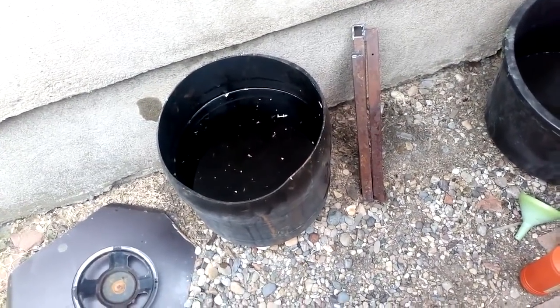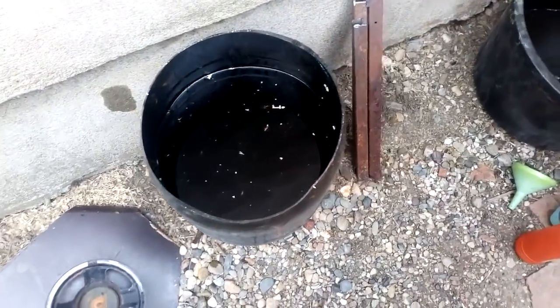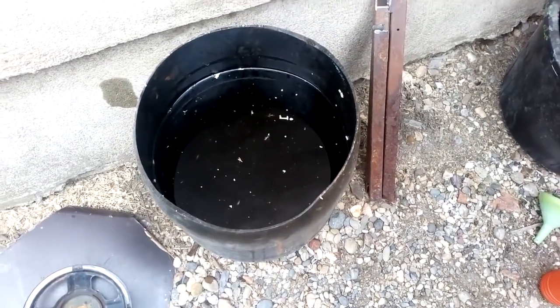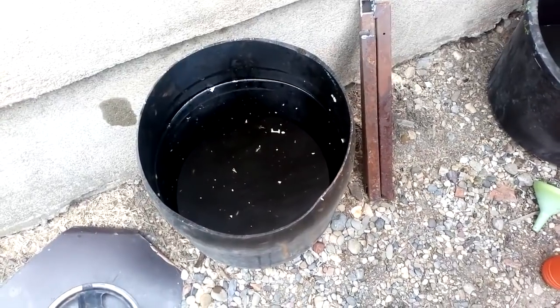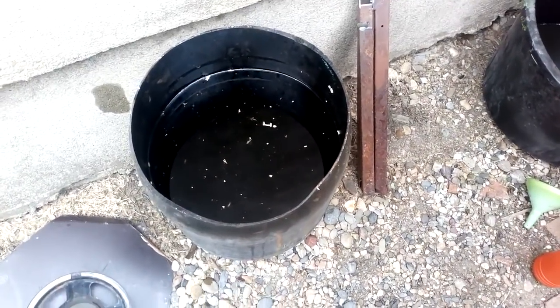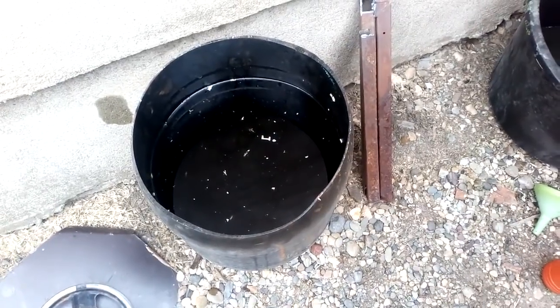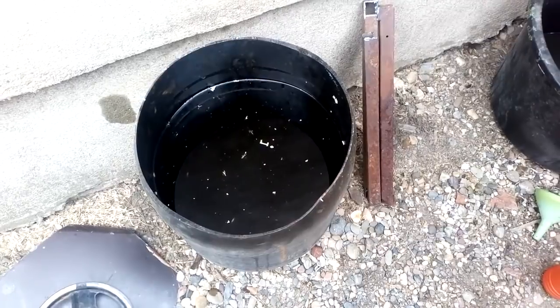This barrel is my waste aqua regia. This solution has been sitting in the stock pot for a couple of months while I removed all the gold. So now it's just waste and there's a lot of dirty solution inside.